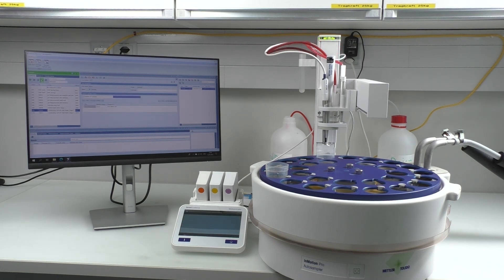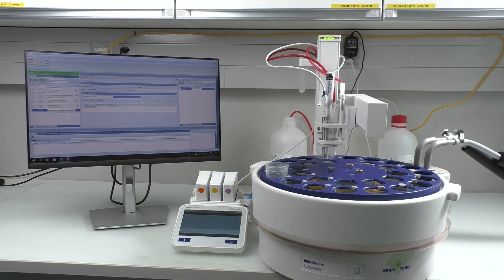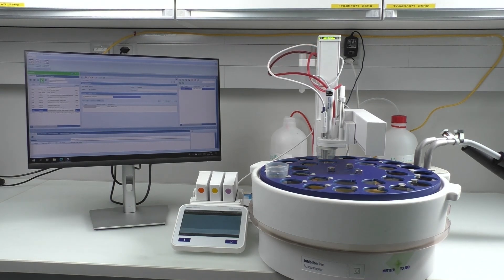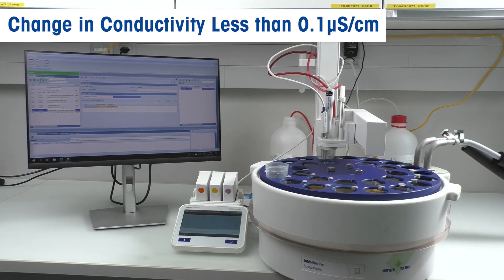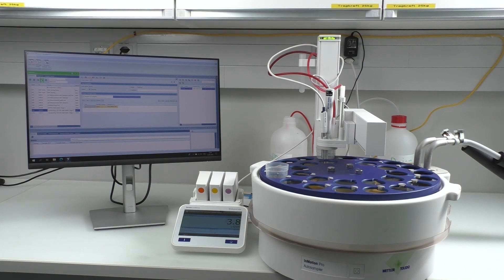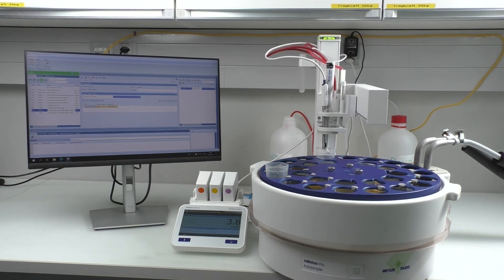While maintaining the temperature, we stir the sample and observe the change in conductivity. Once the sample reaches the phase where the change in conductivity is less than 0.1 microsiemens per centimeter per 5 minutes, LAB-X evaluates the conductivity value. This value is reached when the sample is saturated with air by absorbing carbon dioxide from the atmosphere.